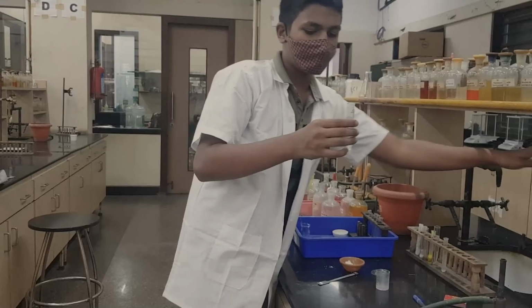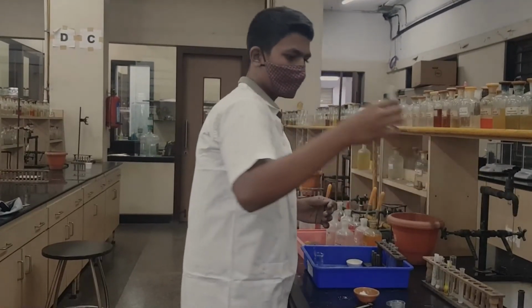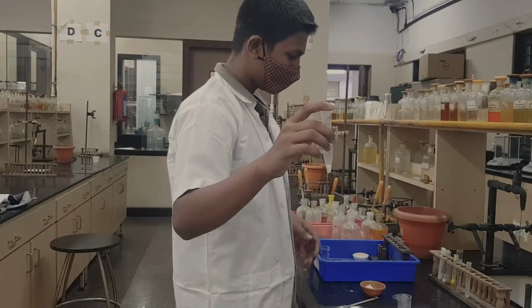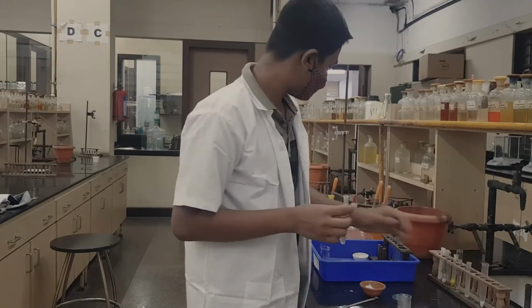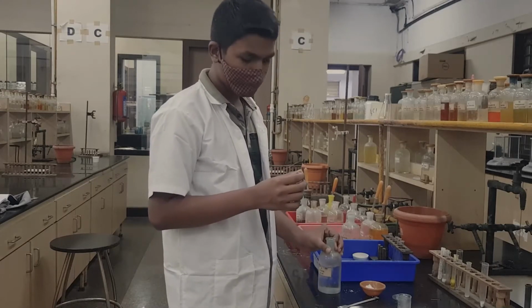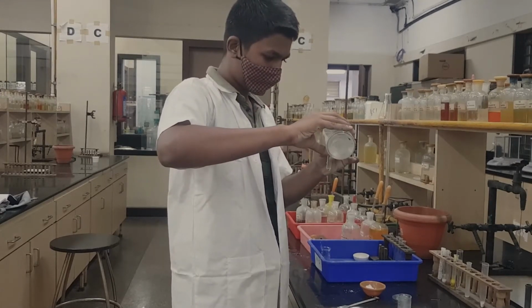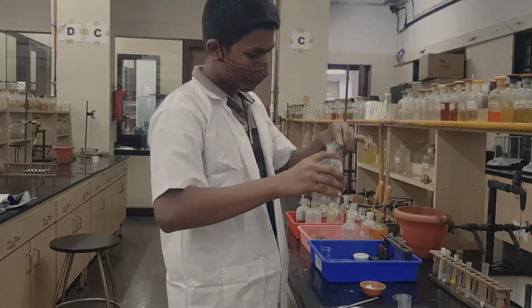You have the solid precipitate, and you can just throw away the solution, which is called the centrifugate, which we reject. Now we are left with only the precipitate. For group 5, the reagent which is required to dissolve the PPT is acetic acid. So we have to warm the acetic acid a little. We are going to dissolve the PPT in hot acetic acid.